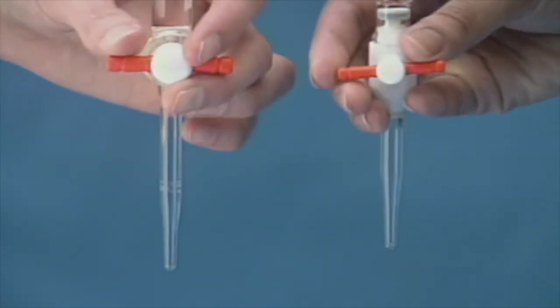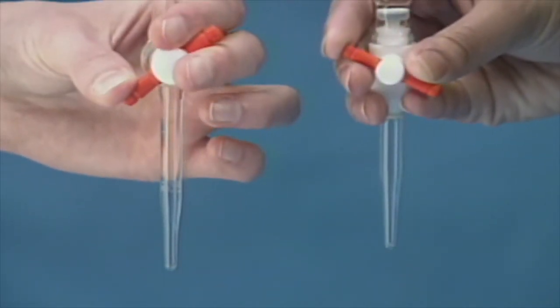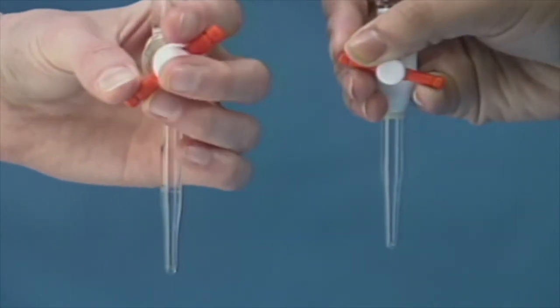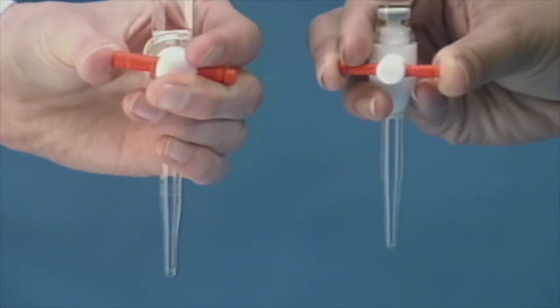Different stopcocks have different flow adjustment requirements. It is wise to practice flow control techniques with your burette before you begin titrating.